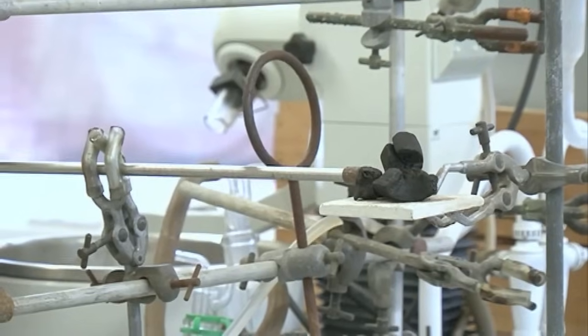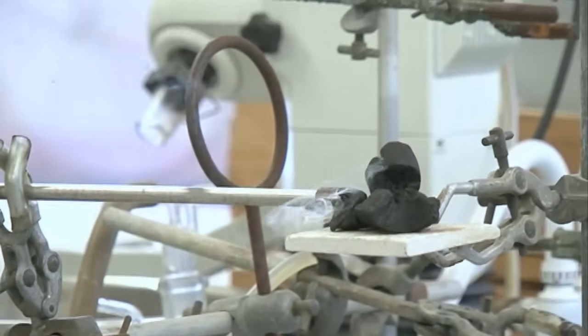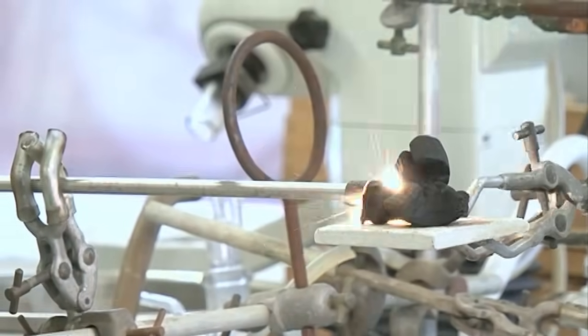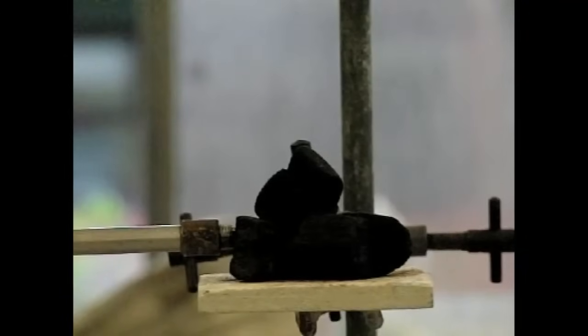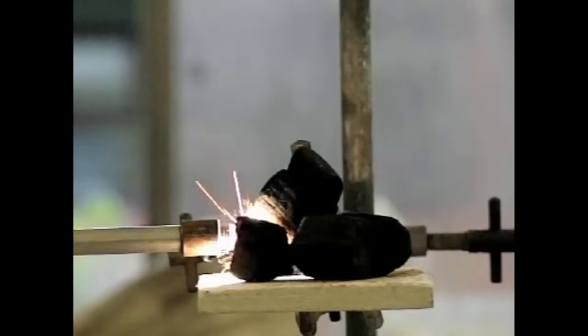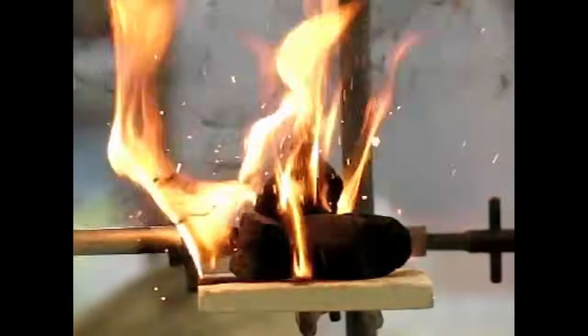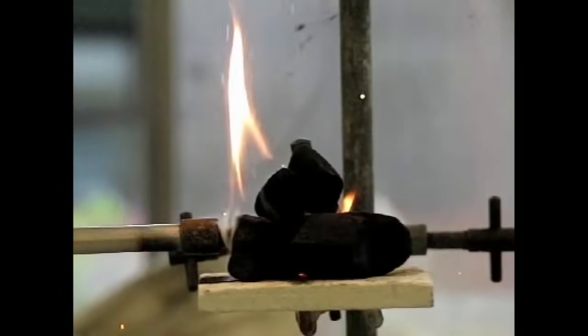I've changed the prop now for some just normal barbecue briquettes. So this is pure carbon. So we haven't done anything. This is cold charcoal and cold gas. And the gas just touching it is enough to start the fire. Think of that. Just the cold gas setting things on fire.